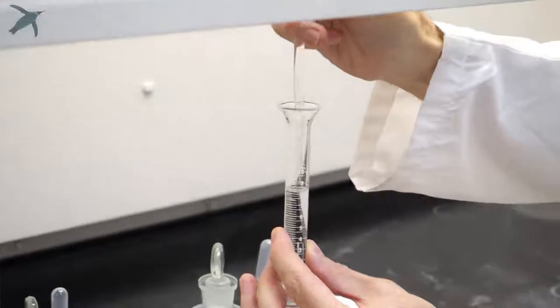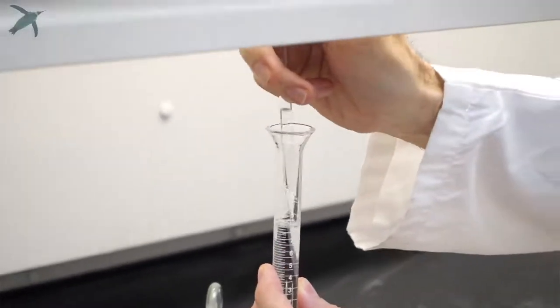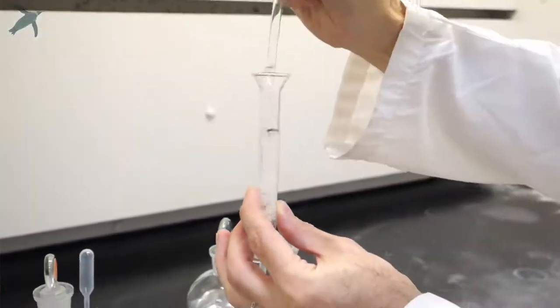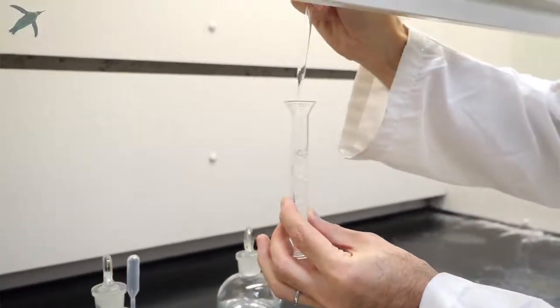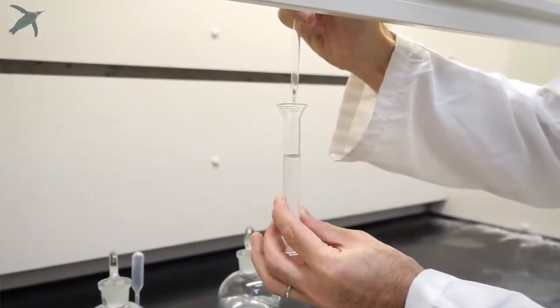Then you pipette up and down the contents of your cylinder a few times to make sure everything is mixed. And now your solvent is ready.